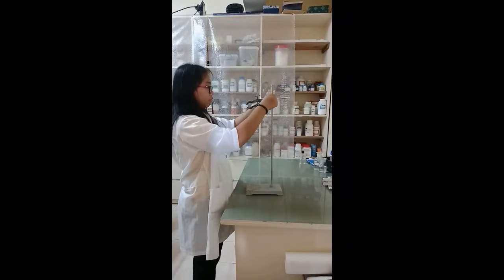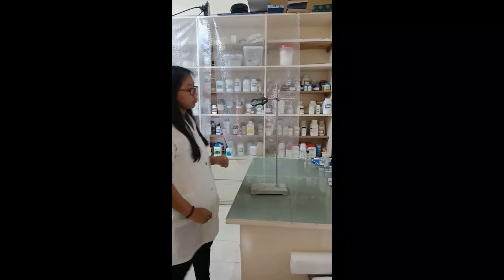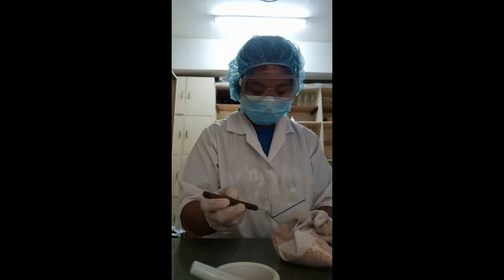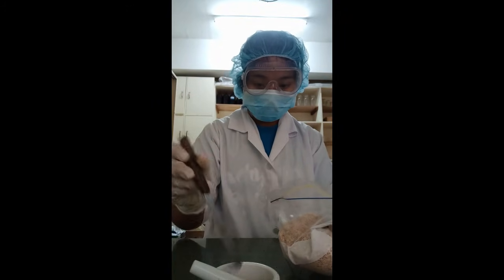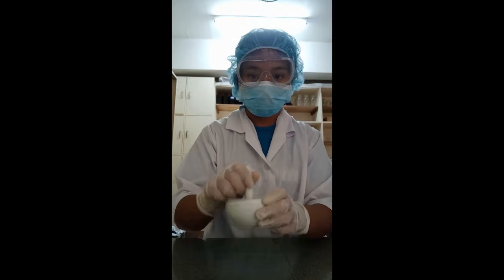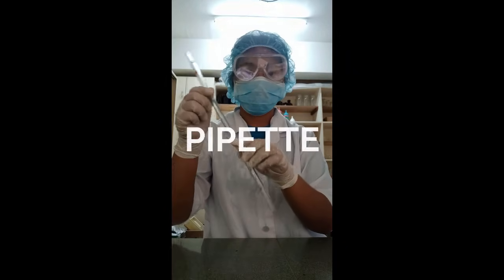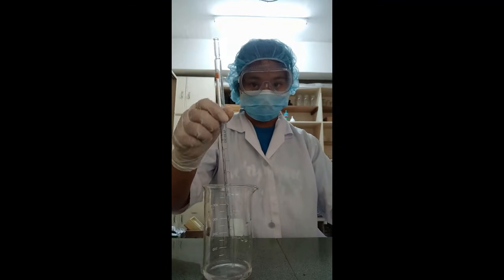Iron clamp. It is used to clamp onto a ring stand to hold a glass tube. Mortar and pestle. It is used to grind solid chemicals into fine powder and crush solids into smaller pieces. Pipette. A long glass tube that measures an exact volume of liquid and places it into another container.